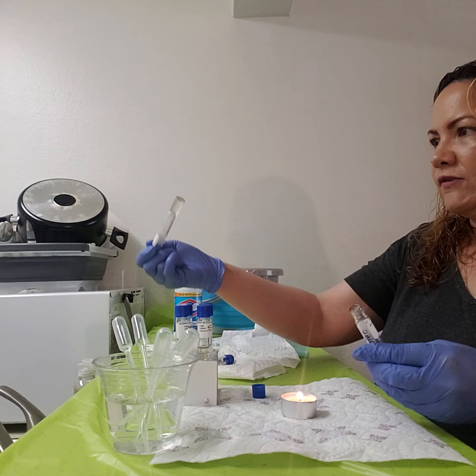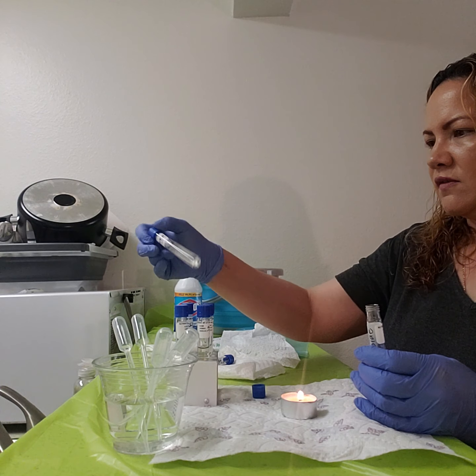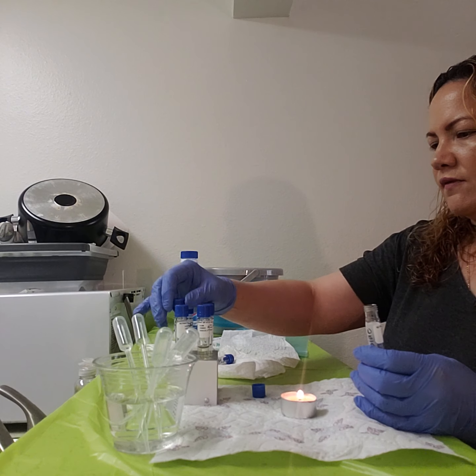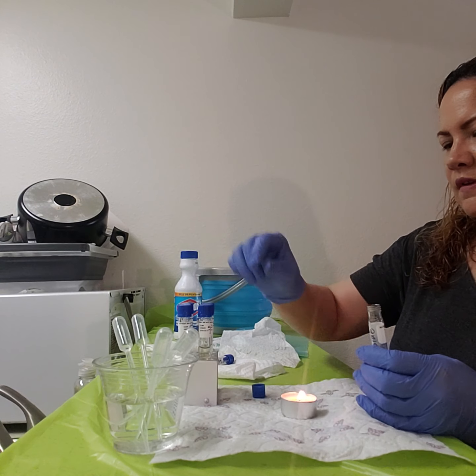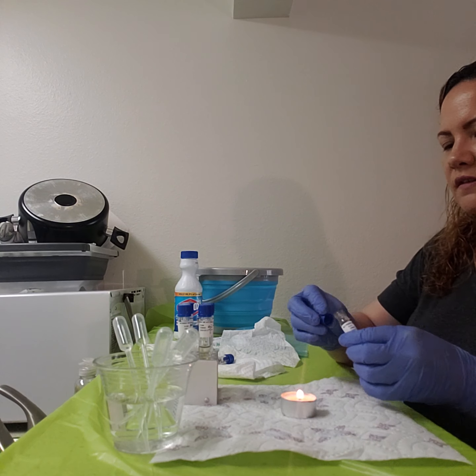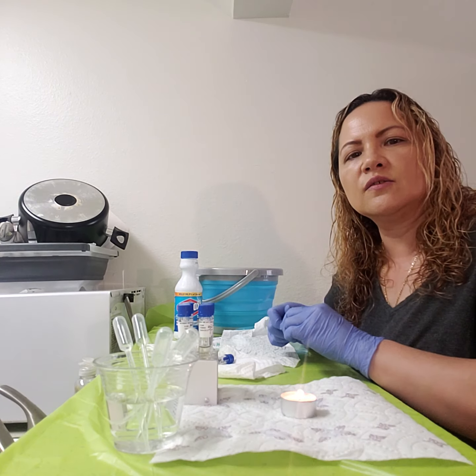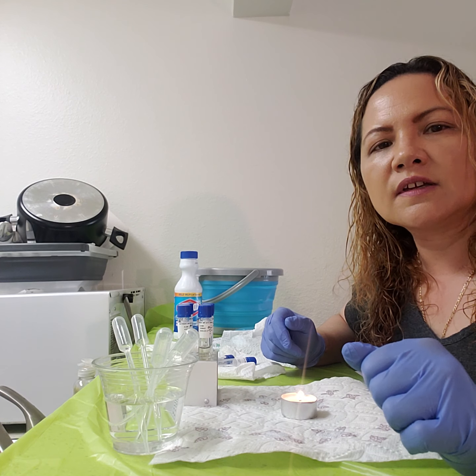So again, this is the 15%. And of course I didn't move it around as much as I should have. Okay. And let me go ahead and sterilize this. Now this is going to be again a 2-day incubation. So I will give you the results in the next 48 hours.